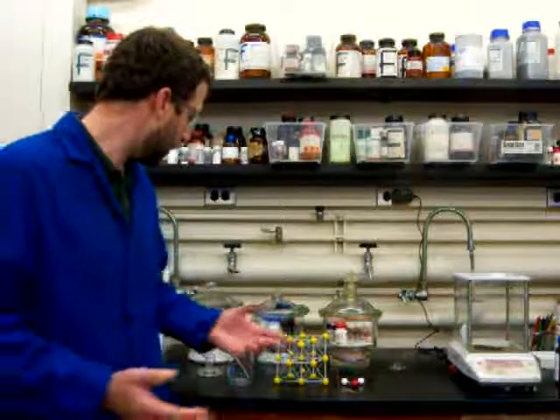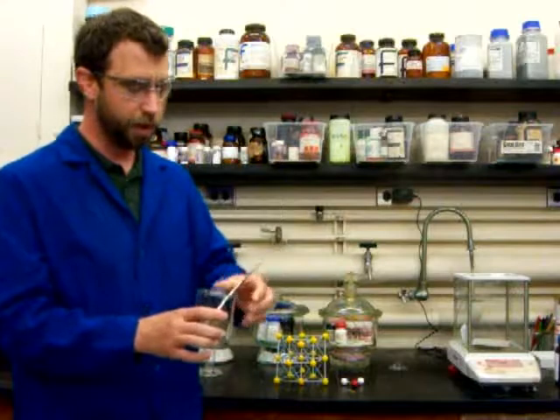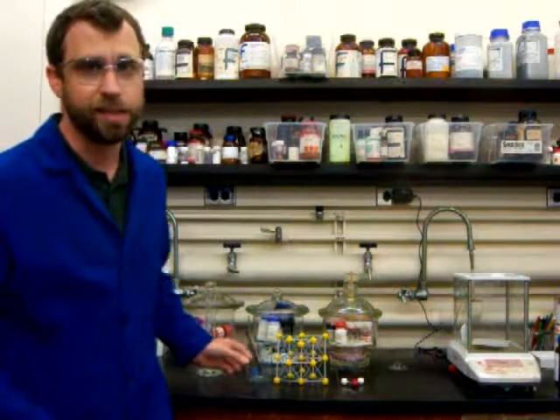So the research in our chemistry lab deals with the synthesis of new molecules and materials. In many ways, we're like chefs that are designing new recipes or new dishes. And the tools that we use are actually pretty similar to the types of tools that you use in your kitchen. For example, we have spatulas and measuring cups. Okay? But our specific expertise is the synthesis of inorganic molecules and materials.